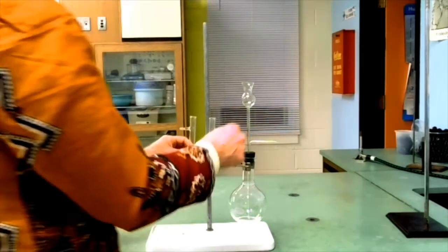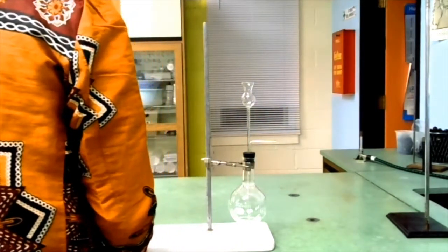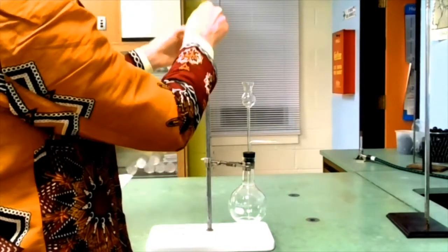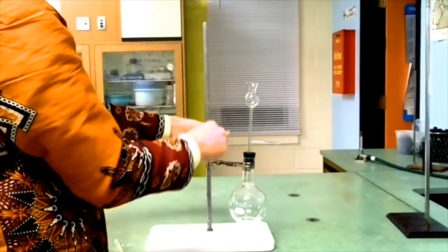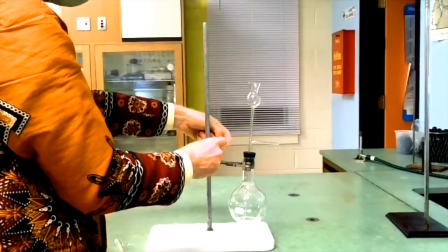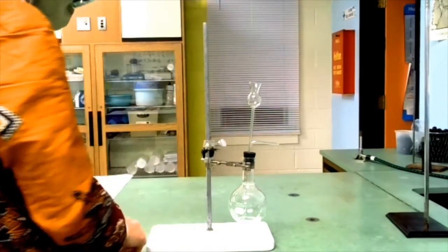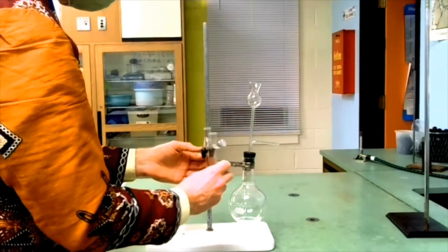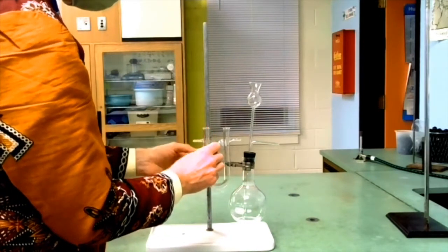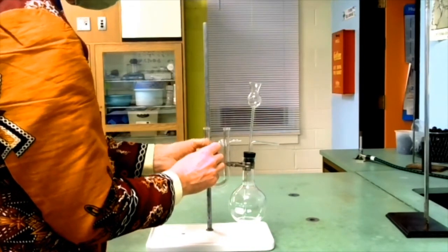Next for the drying tube, I'll need a clamp for that. I'll have that in the middle. Tighten that down.